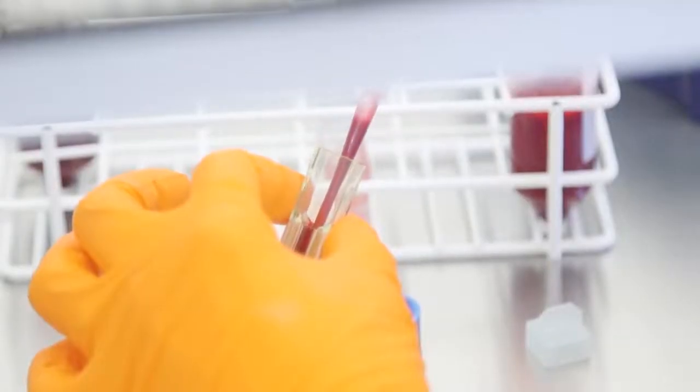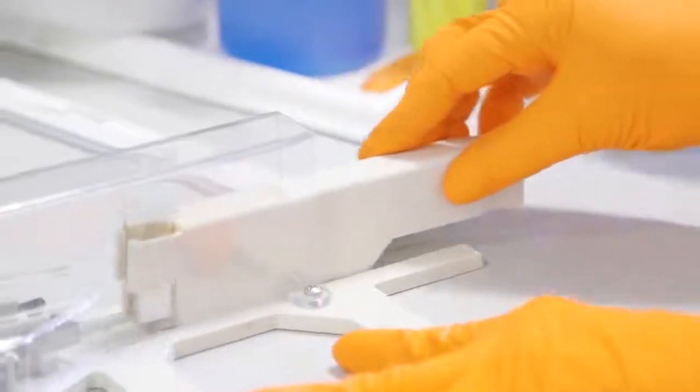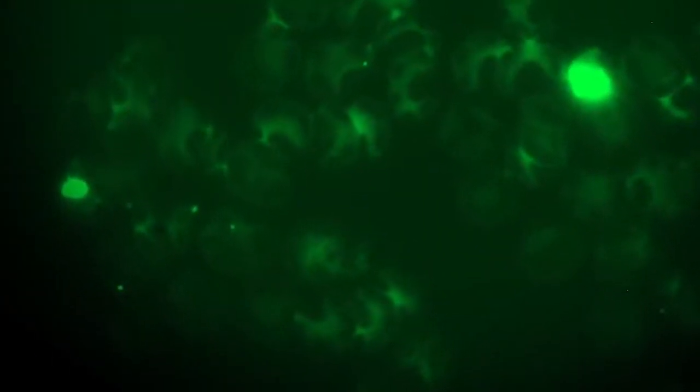We genetically modify the parasite to knock out or modify certain genes in order to assess whether these are involved in the disease. We also introduce fluorescent proteins into the parasite to be able to follow it throughout the infection and assess its ability to invade particular red blood cells.